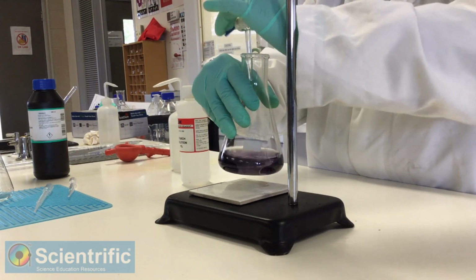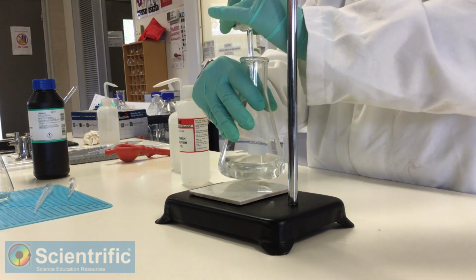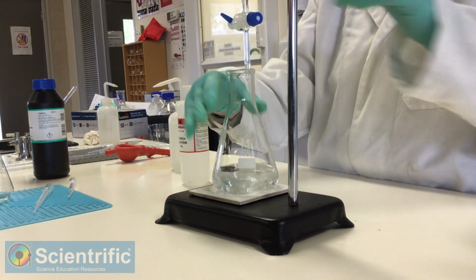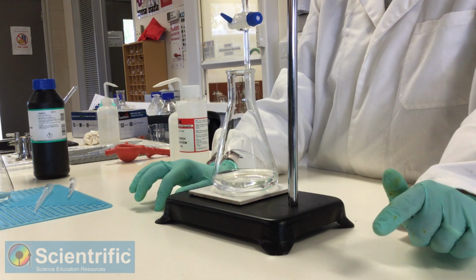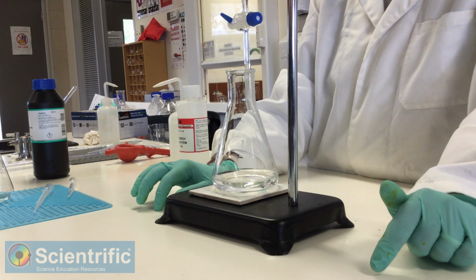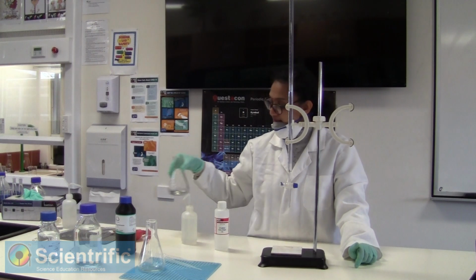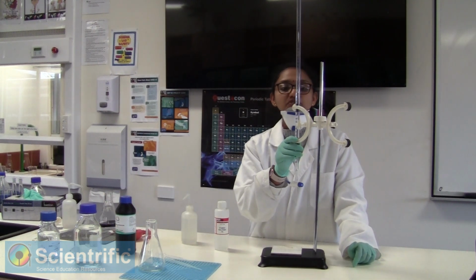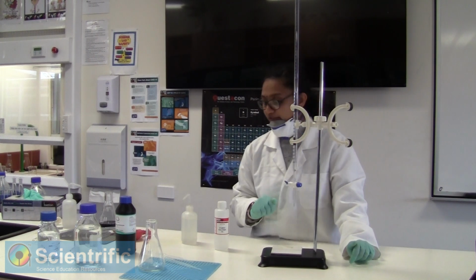It's just that something more oxidizing is getting into it. Okay. That's an endpoint for us there. So that comes to 29.1 mil, 29.1 mil.